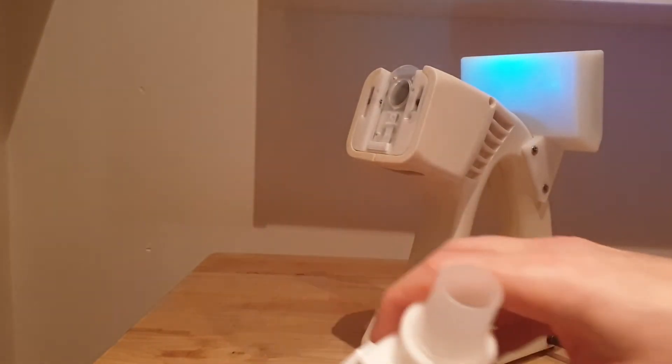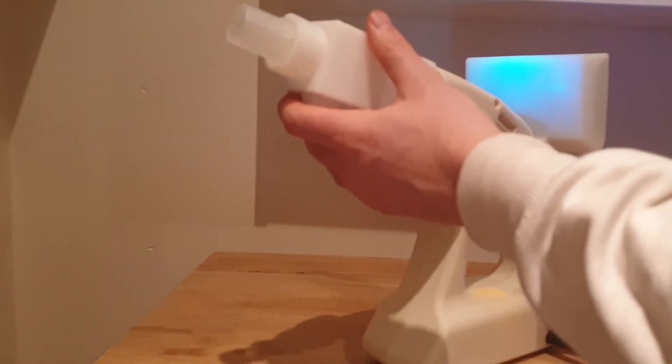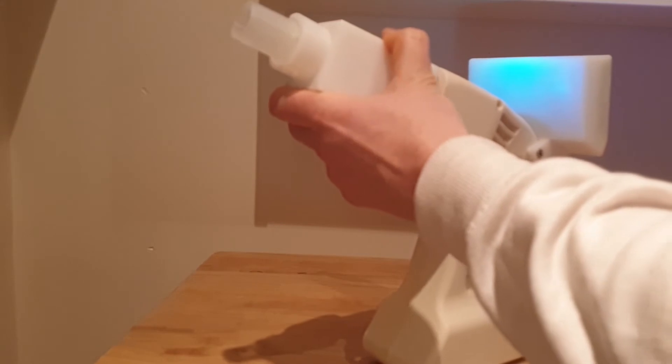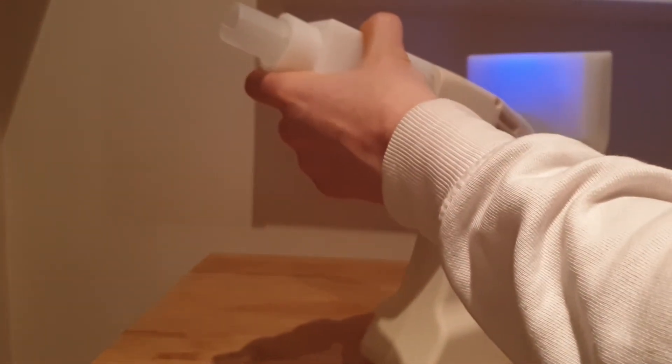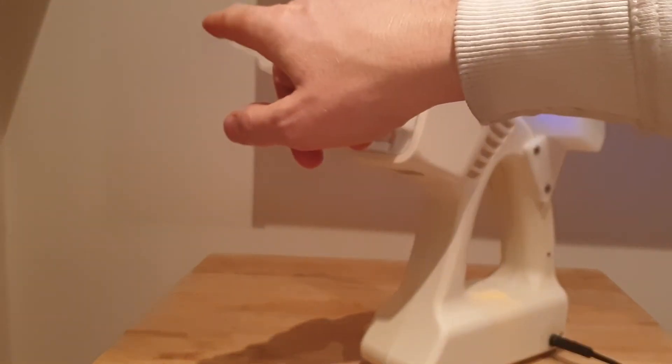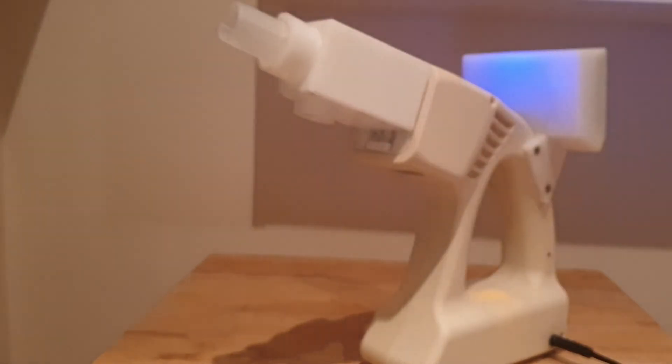Now, if you want to be more specific about what materials actually reaching the condensing plate, then we have like that, and that clips on the front. And then you can basically, if you have an exhaust that you want to direct, we can then direct the exhaust onto there. So I'll just have a look.